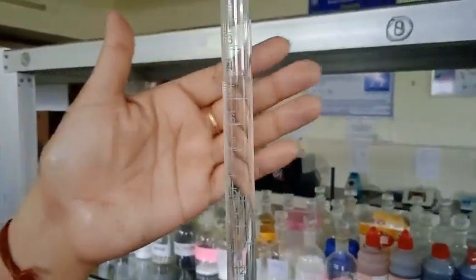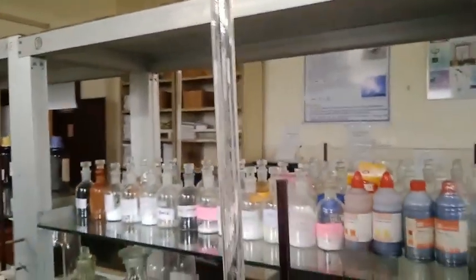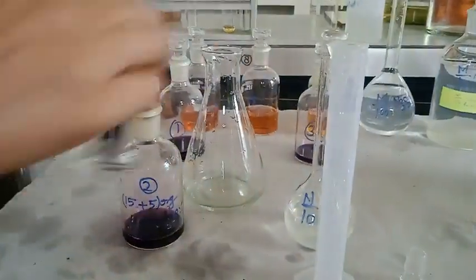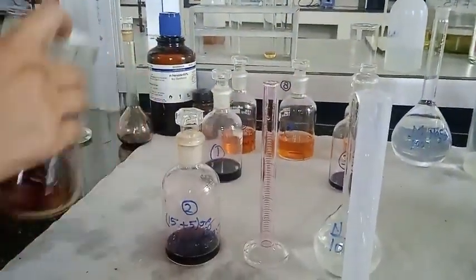So it is about 4.4, and the same procedure is repeated for set number 2 and set number 1. Here I sped up just to save time, and here you can see the color change, and we are now going to titrate it.